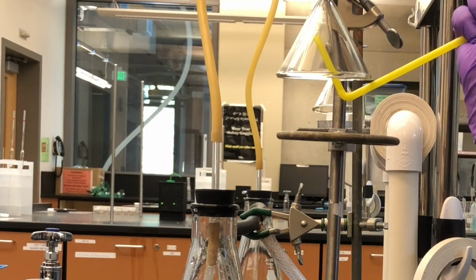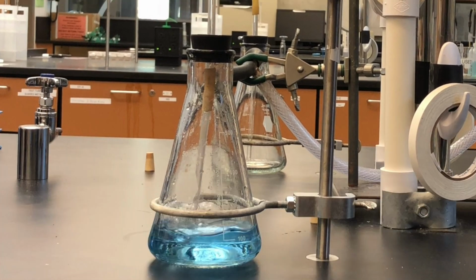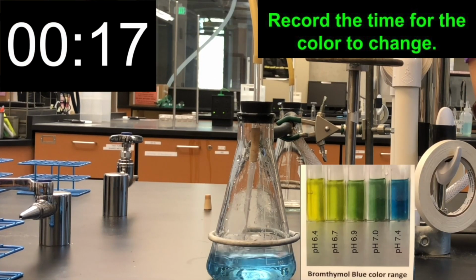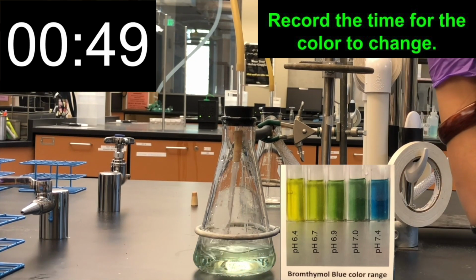With your mouth, exhale into the inverted funnel. The carbon dioxide released from your lungs will react with the water. Turn on the vacuum aspirator. Observe the reaction and record the time needed to turn the color of the solution from blue to yellow.